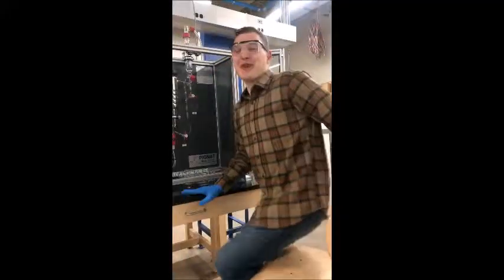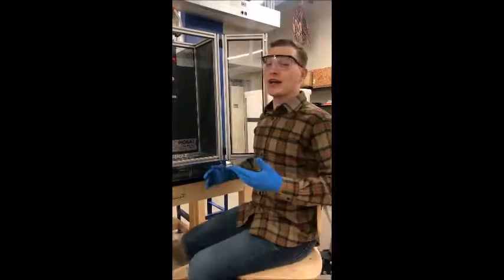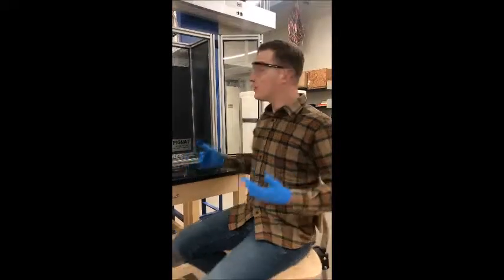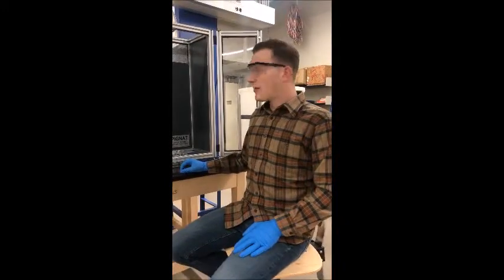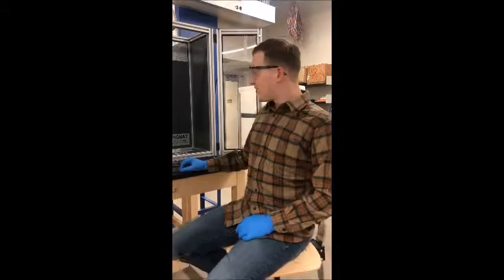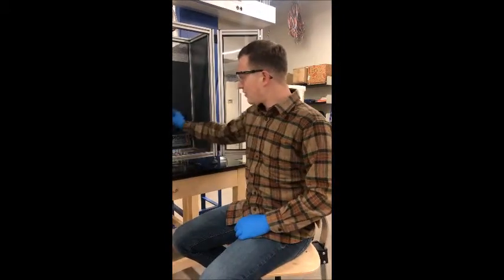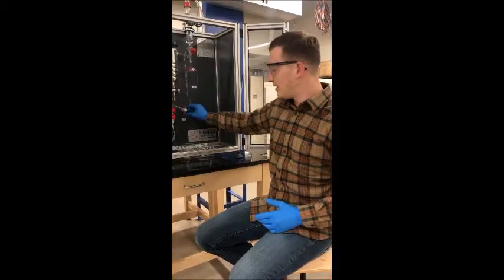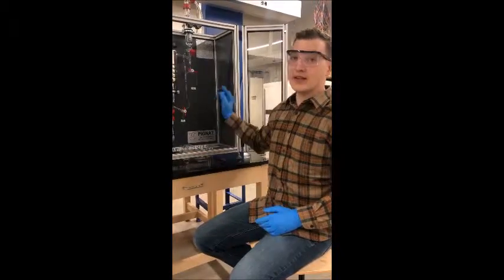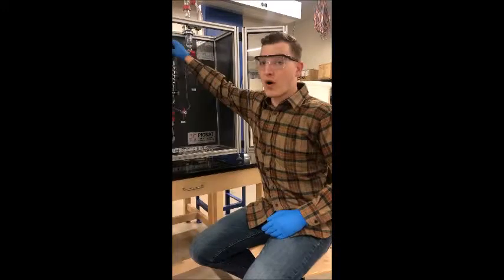For our 10 separate trials, we're going to have to vary the concentration, and that involves diluting the solution that's in the equilibrium still. What that entails is that we're going to have to drain excess fluid out of the still so it doesn't overflow. That's done simply by using the bottoms valve and emptying a certain amount that you've already measured based on your data sheet out of the system, and then diluting it with the proper amount of water in the top.